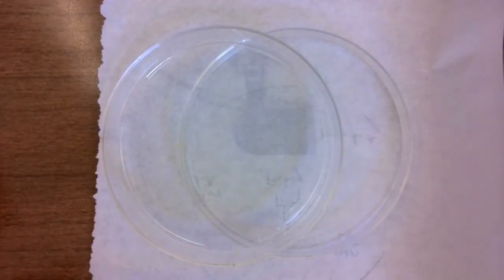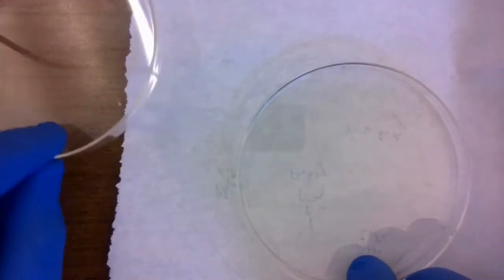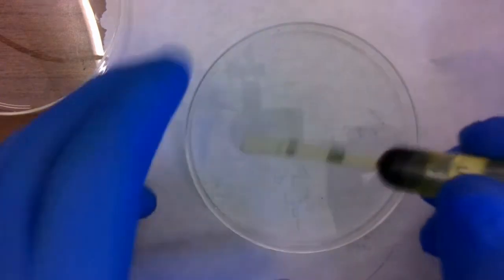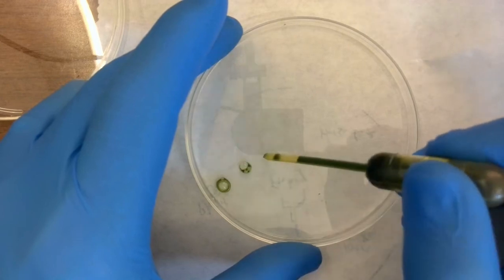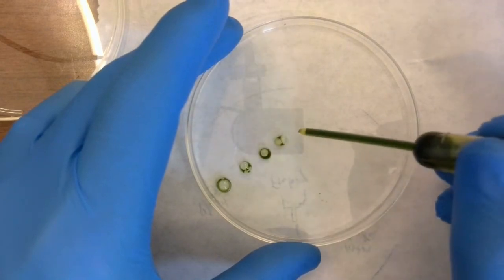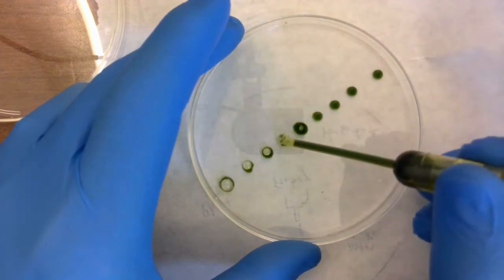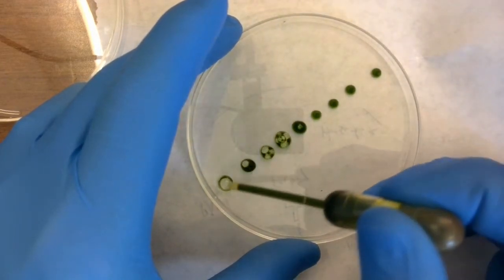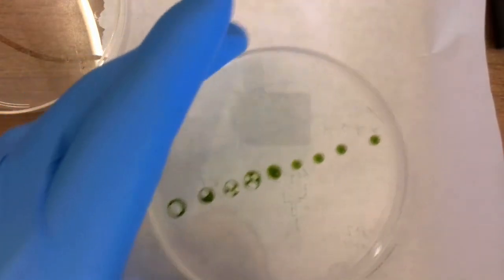Now for the actual lab that we're going to do, you'll notice I'm using a Petri dish here, and it has 2 pieces, a lid, which is a little smaller, and then a base. And we'll come back to the base in a minute. I'm going to start off by putting a line of universal indicator drops, just tiny drops here, along the lid, and these are going to simulate our clouds. There we go. I might come back and get a few more of those. Those bubbles are really messing with it. All right, so we can see those are green because they're neutral.